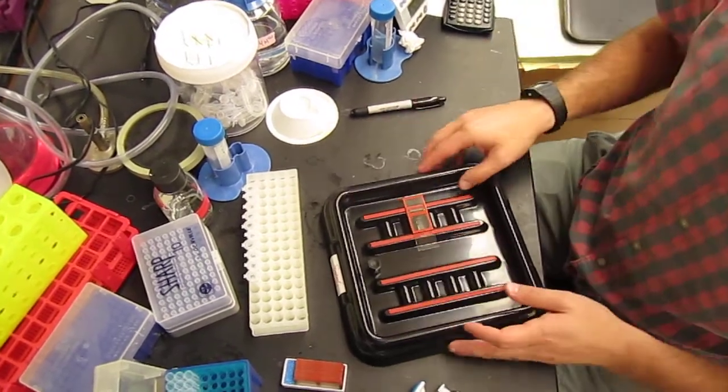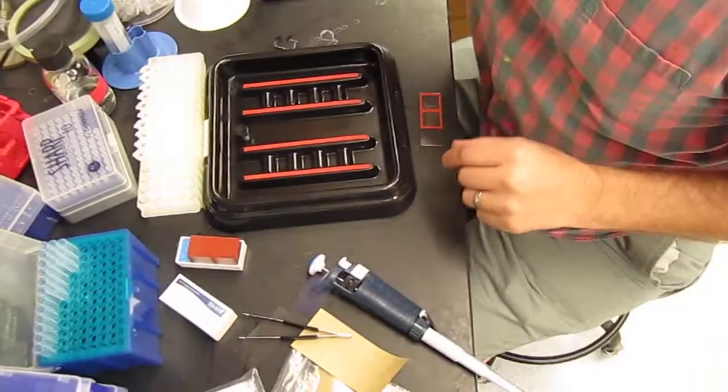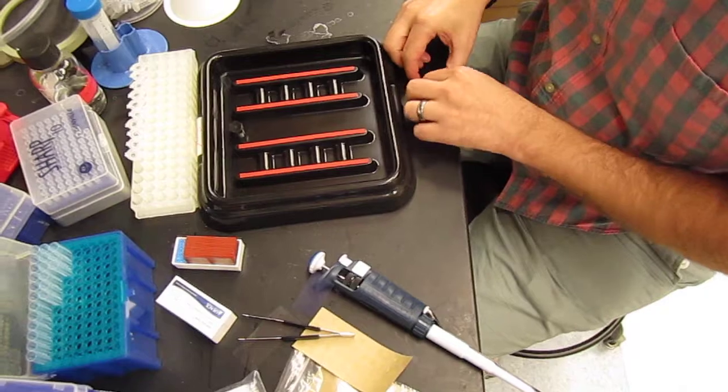And we're going to make sure it's sealed by flipping the slide on a clean surface and rubbing the back of the slide with a Kim Wipe.